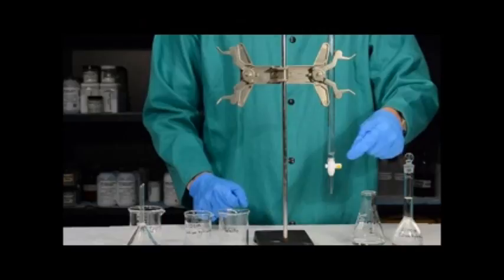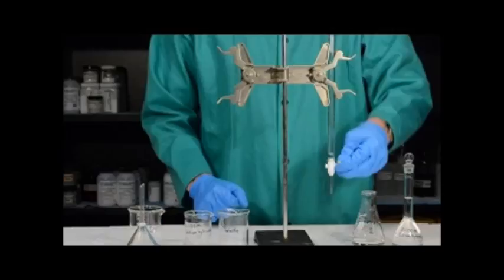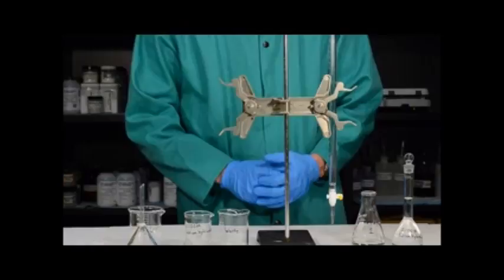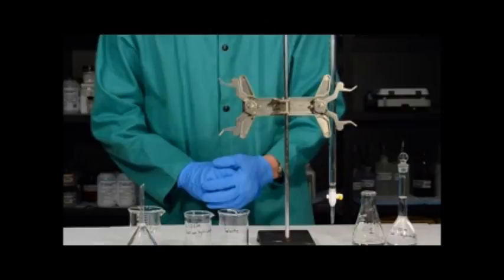Notice that a burette has a stopcock at the bottom. When the stopcock is perpendicular to the burette it is closed; when it's parallel, it is open. For right now, make sure the stopcock is closed. Before and after you use a burette it's always important to rinse it with water — before to make sure it's clean, and after to make sure there's no remaining sodium hydroxide solution. Sodium hydroxide solution left to evaporate will leave solid sodium hydroxide in the burette, which can clog the very tiny hole at the end, so always rinse before and after use.